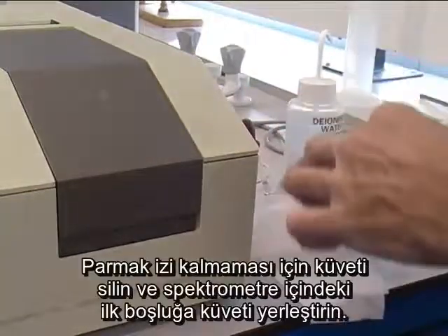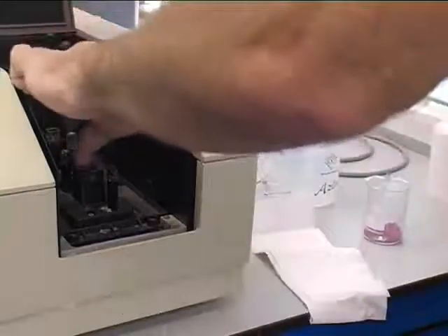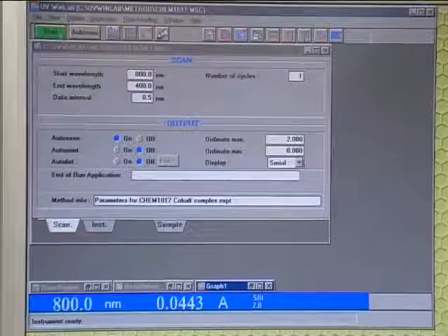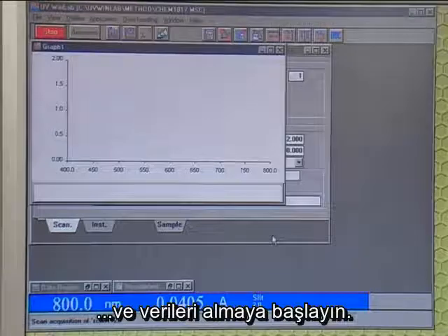Wipe the cuvette down to make sure there's no finger marks, and place the cuvette into the first hole in the UV Vis spectrometer, still leaving 1 blank cuvette in the second hole. Now click Start to run the program, and this will acquire your data for you.